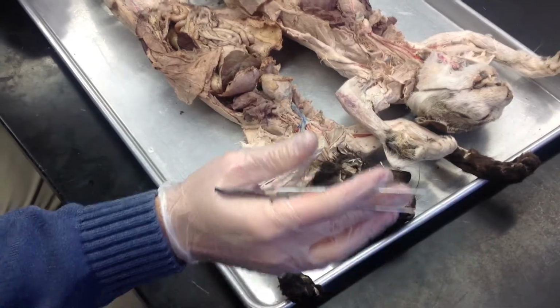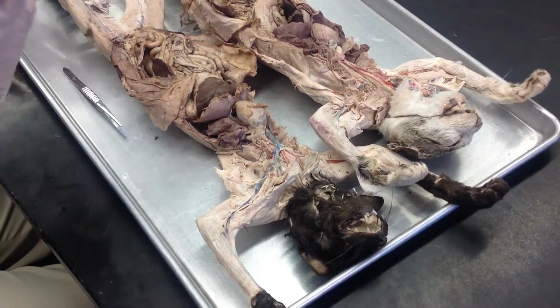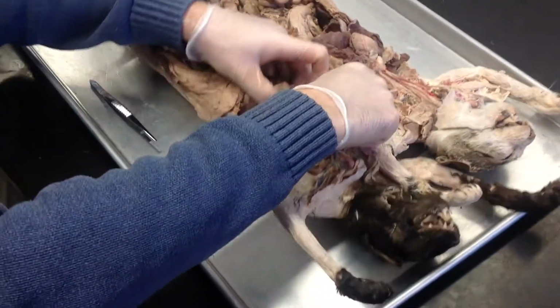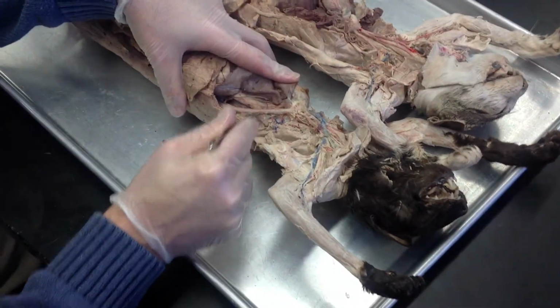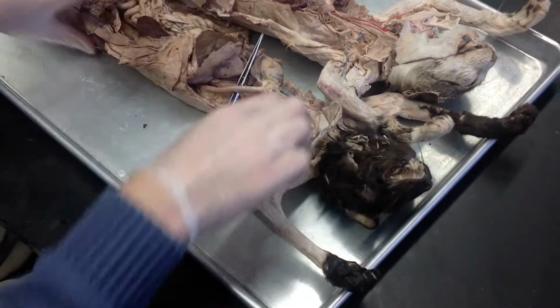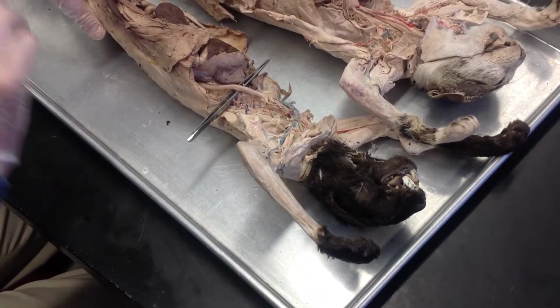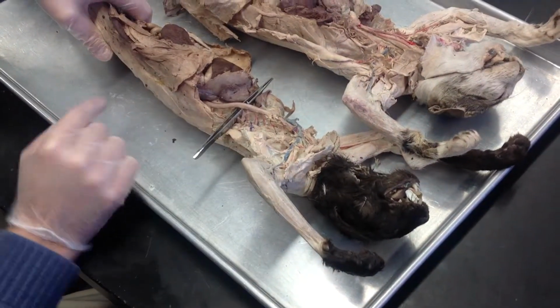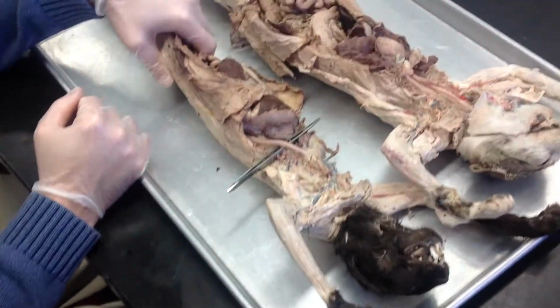Okay. As we then move inferiorly, having talked about the brain and back and the arm and back, we can see the thoracic aorta. I don't have a model of it. If I want to ask the thoracic aorta, I'll ask it here in the cat. So the arch of the aorta starts to descend, and if you take your lungs and you expose the left side, you will then see the thoracic aorta. Big, fat thoracic aorta, easy to ask.